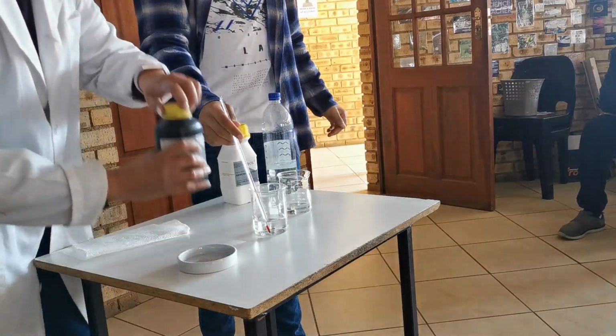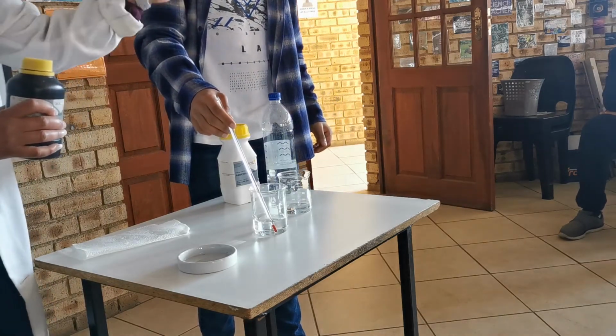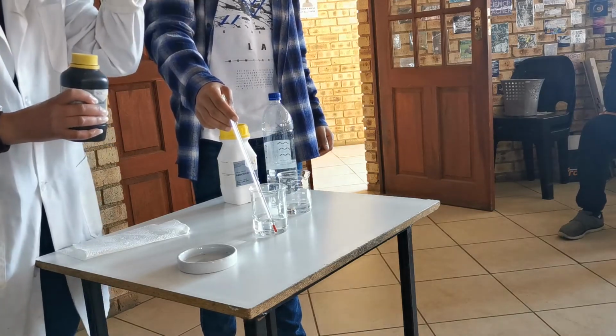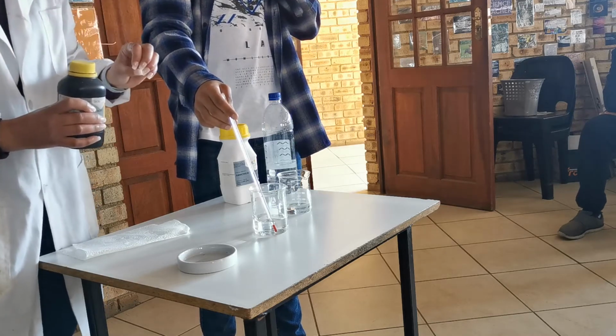And we're now going to add acid to water. A to W, that's the rule. A before W, like alphabetically. Always. Tuck that somewhere, it's a big deal. If you do it the other way around, it's dangerous.